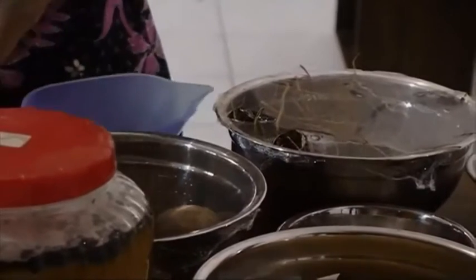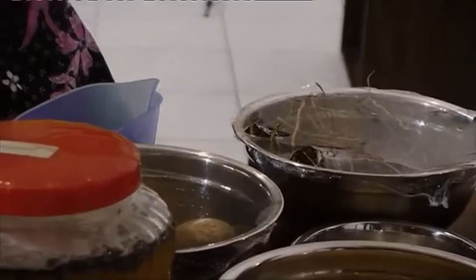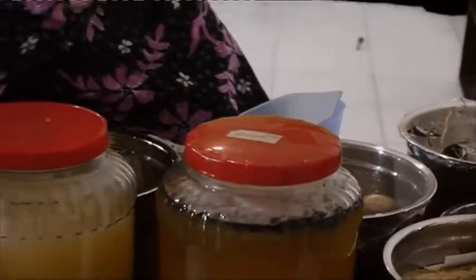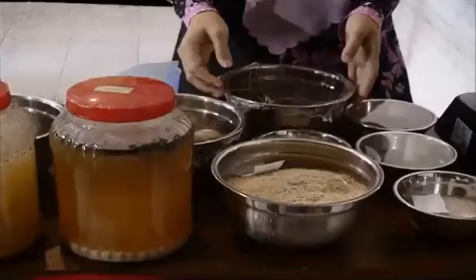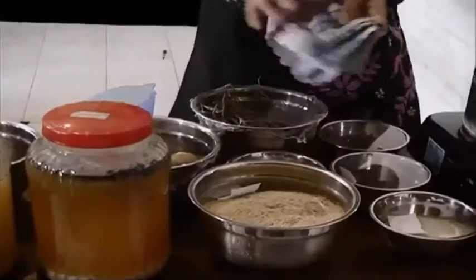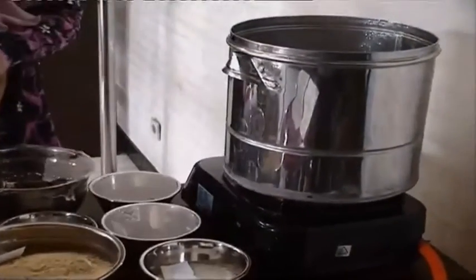After we have the starter, the bamboo root is soaked in boiled water for 3 days. And then we set it aside and make the medium for the growth of bacteria. This is boiled water.